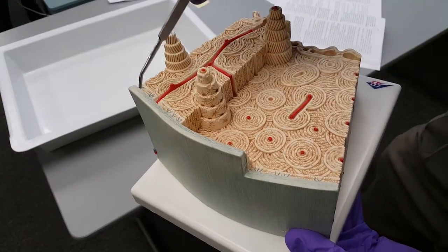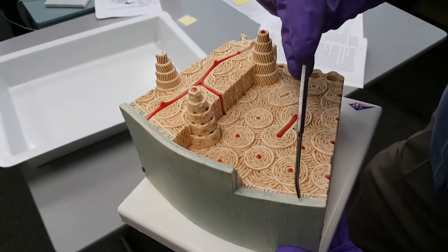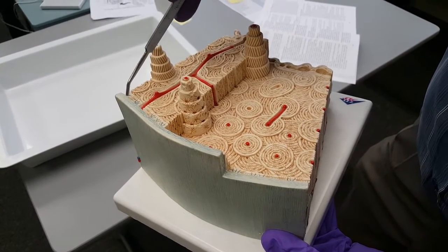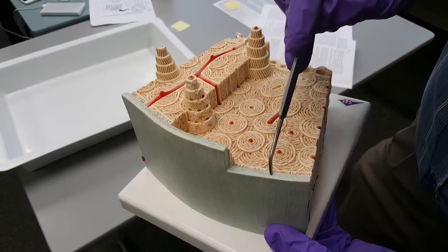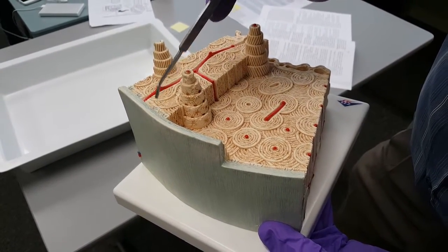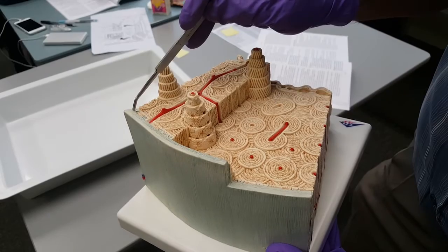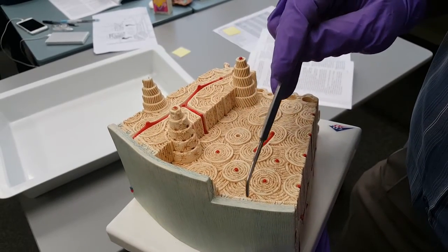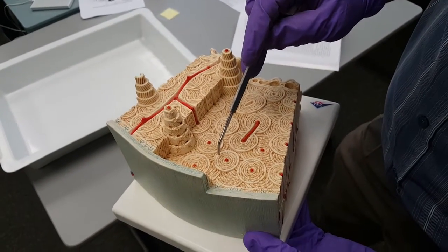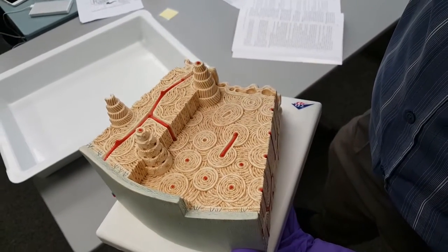Now, getting back to this periosteum, as I said, it's a tough layer. It has a lot of fibrous tissue, and then the inside of this fibrous layer contains a lot of bone cells called osteoblasts. Osteoblasts are cells that produce new bone matrix, and they are found on the inner aspect of the periosteum. I mentioned just before that sitting in the lacunae you have osteocytes, which are mature bone cells that maintain the matrix.